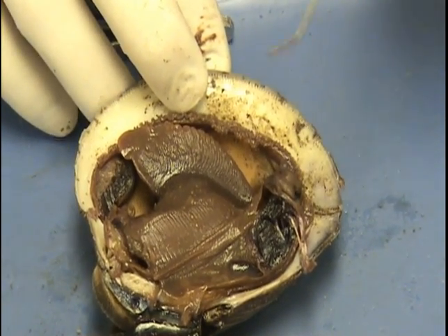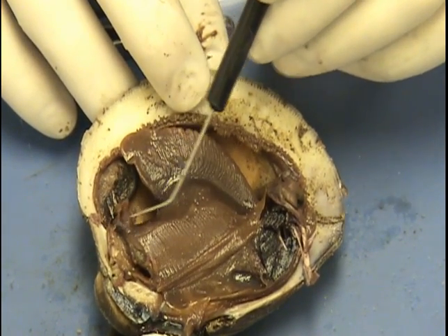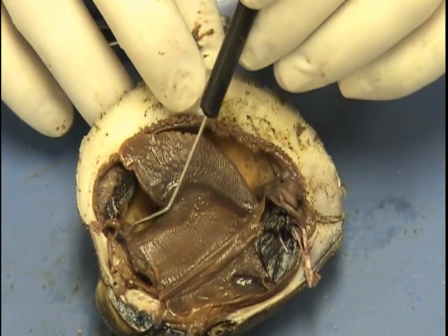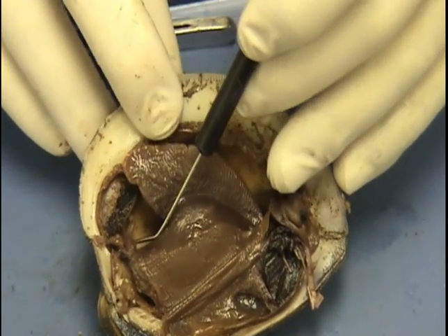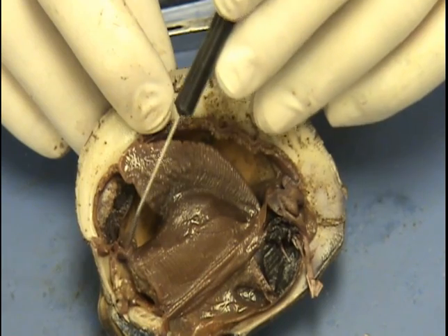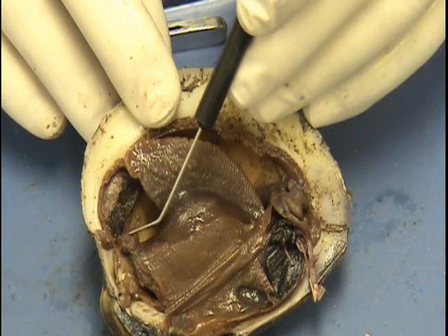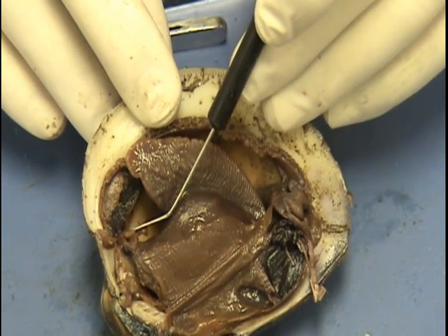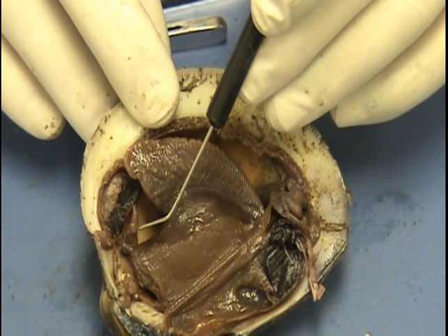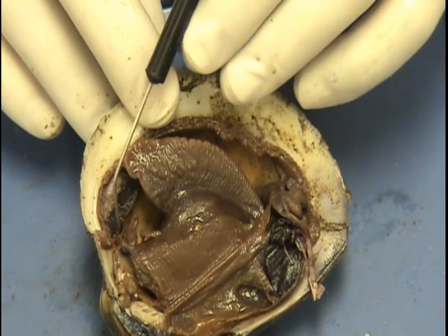The next thing are the palps. Here are the palps — and since this is a bilaterally symmetrical organism, there are palps on the opposite side as well. The palps lead to the mouth; the mouth is kind of hard to see, it's right there. The palps help guide the mucus loaded with food to the mouth.